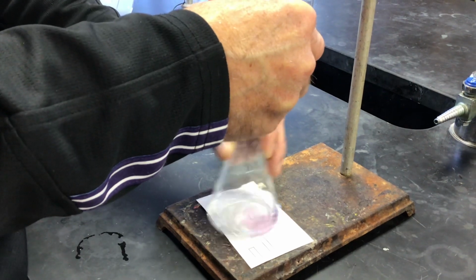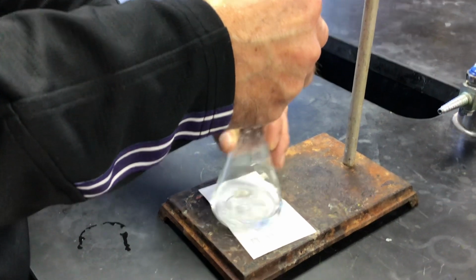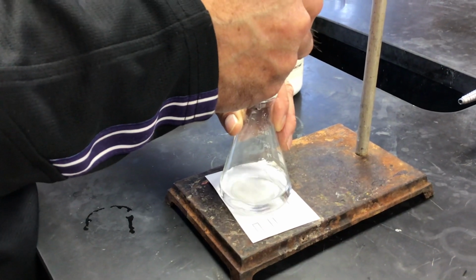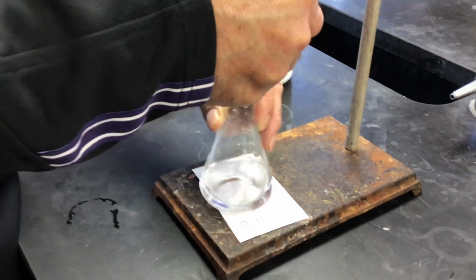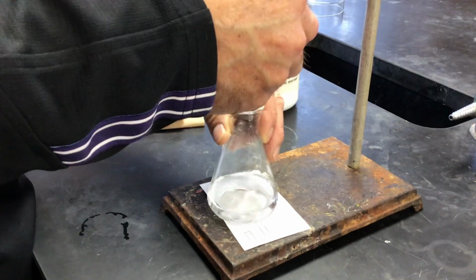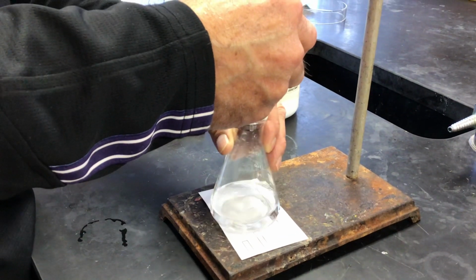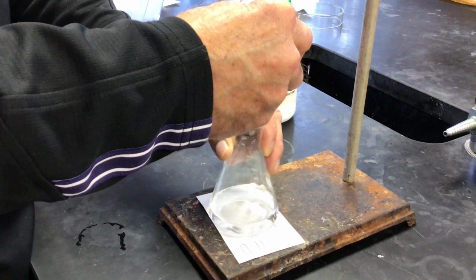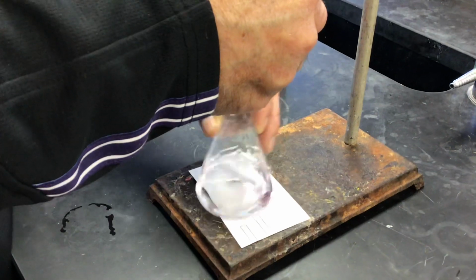Oh, looks like we're close. Oh, that's super close. Okay, no pressure, but I'm trying to get one more drop in there. Okay, maybe this is it.